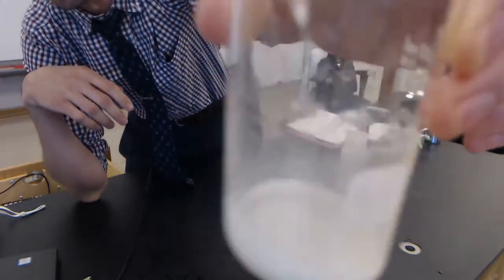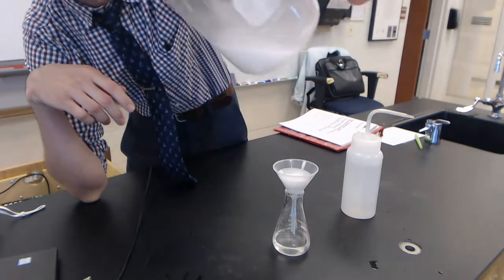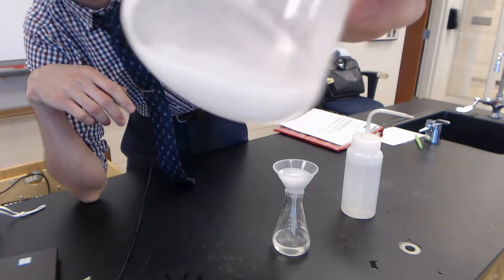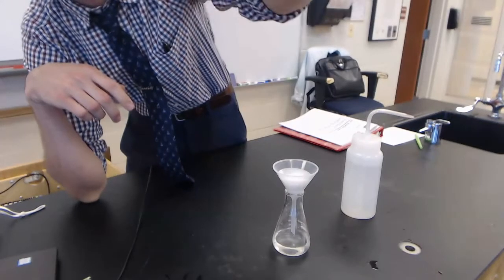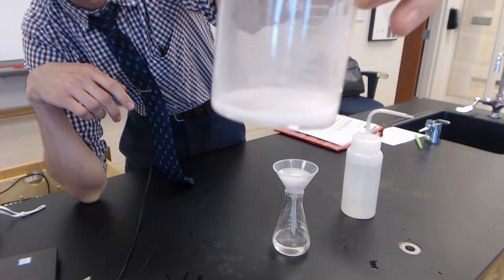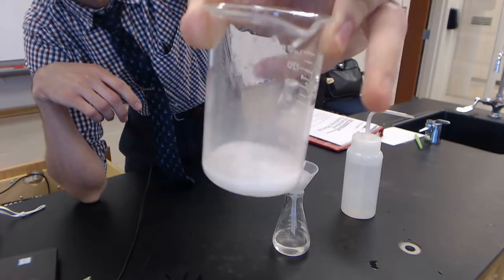What you saw me just do is rinse the inside of this beaker with some more distilled water. The more you rinse it to get the actual white solid in the filter paper the better, but as you can see I'm not going to get all the white solid because some of it adheres to the glass beaker. So error.